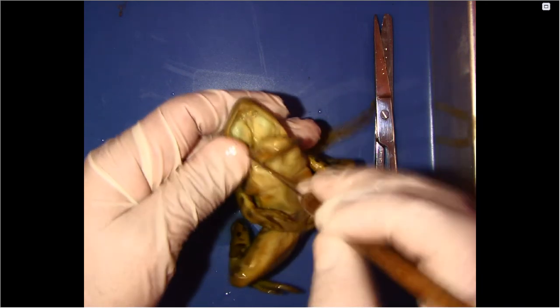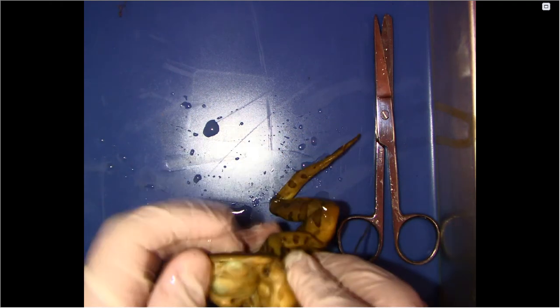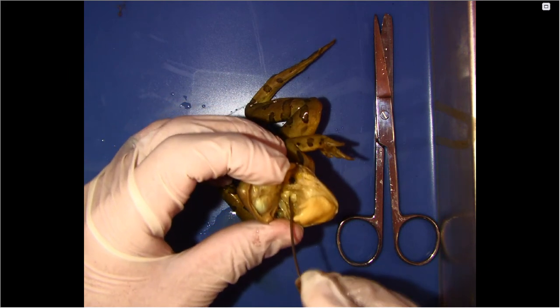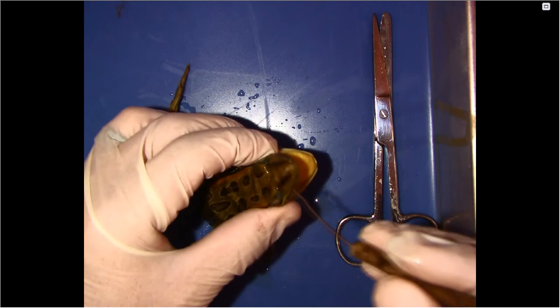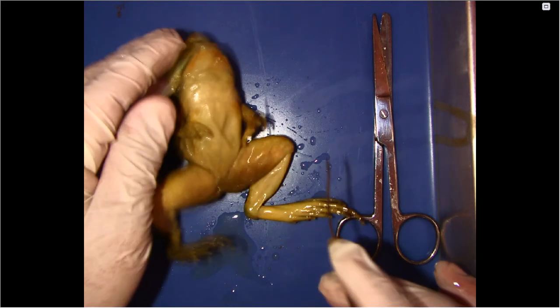Okay. Then underneath, inside the mouth, you can see the two little nostrils that will lead outside. So it has two nostrils here on the outside. So on your sheet, you have several of those parts that you'll have to identify what system they belong to. So what system does the tongue belong to? What system does the esophagus belong to? And then what system do the nostrils belong to? And then name the function of those.